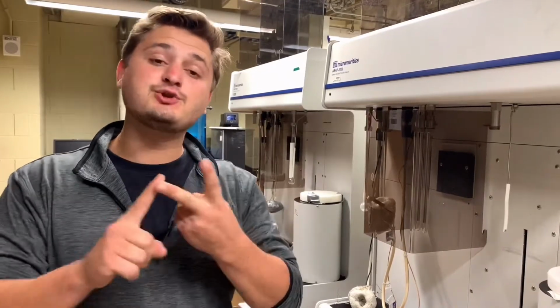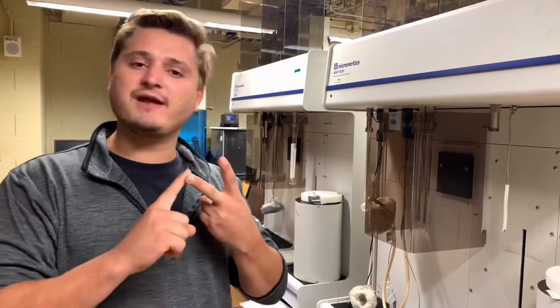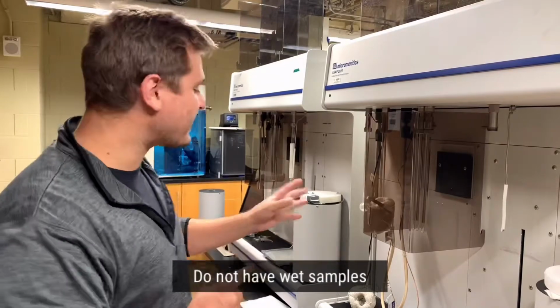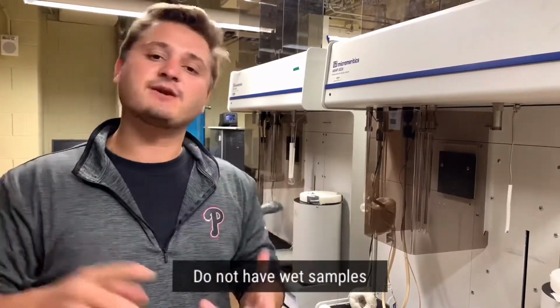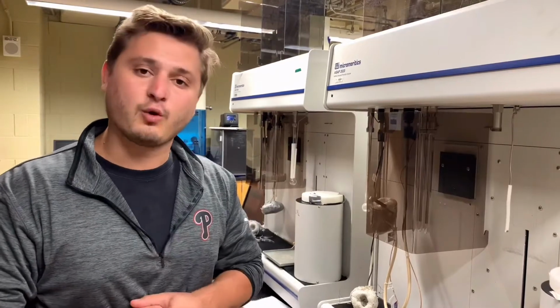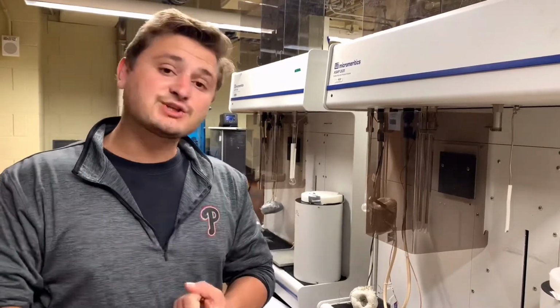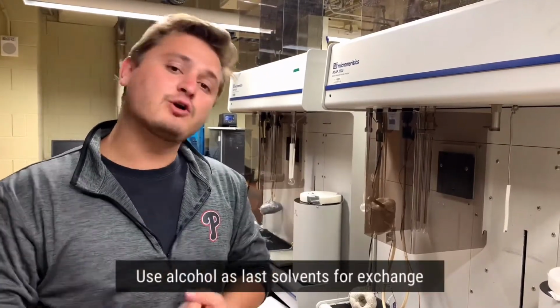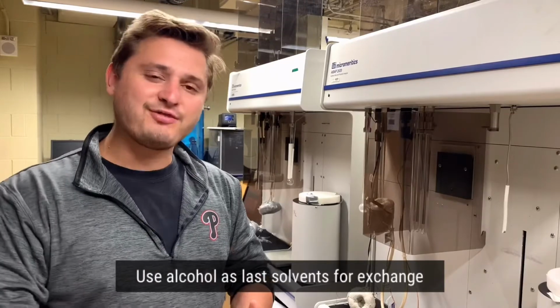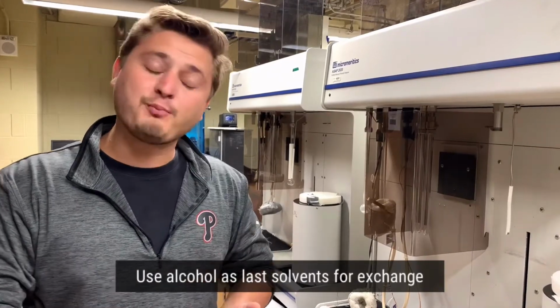This involves the do nots. Do not have a wet sample. Your sample should be completely dry and solvent-free, minus a few solvent molecules that are within their pores. The last solvents that you should use with your samples after the solvent exchange process are alcohols: methanol, ethanol, isopropanol.